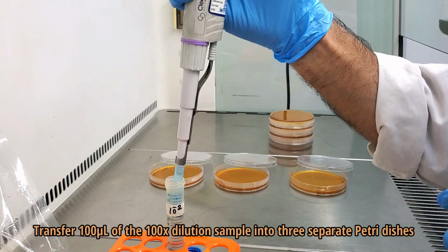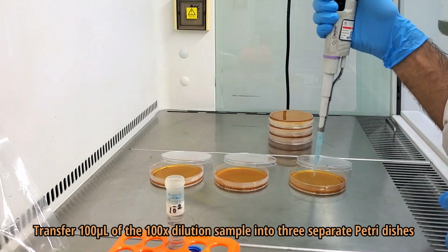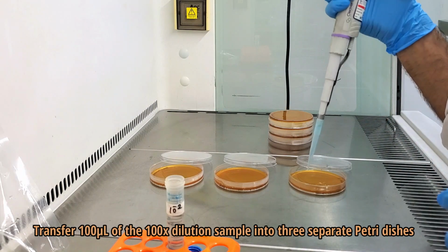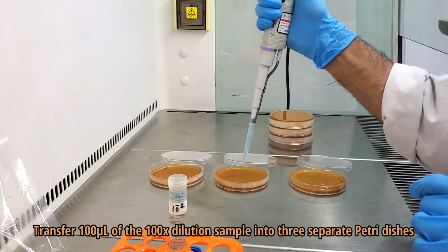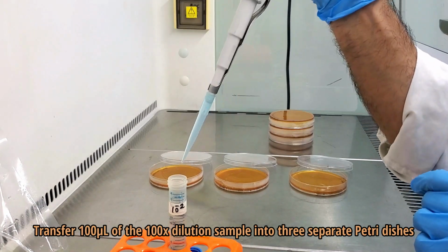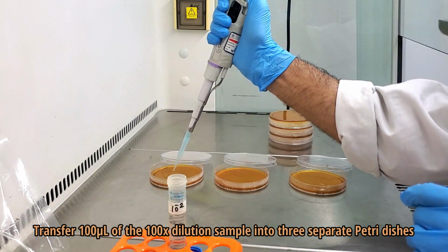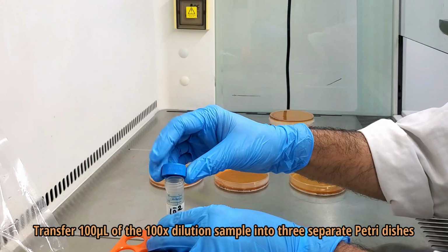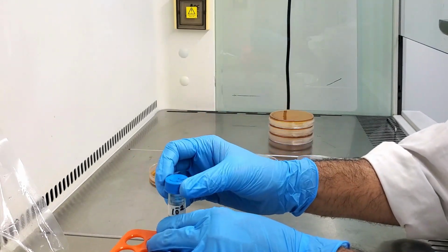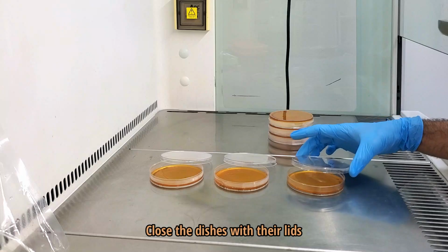Transfer 100 microliter portions of the 100 times dilution sample into 3 separate Petri dishes. Close the dishes with their lids.